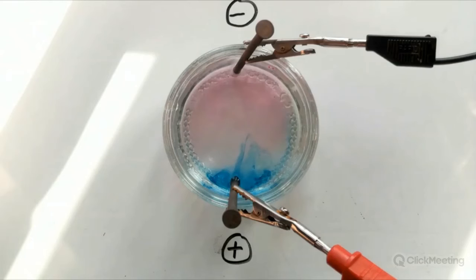So I kind of like this experiment because I think it helps pupils use the science that they've learned in school to critically evaluate the science they will come across in real life, and maybe even it might save them a little bit of money as well in things that are not what they seem.